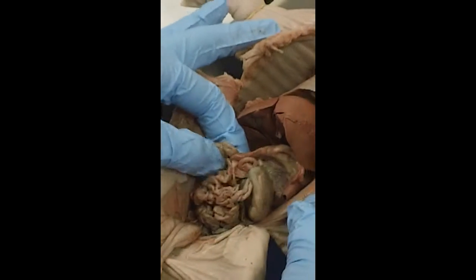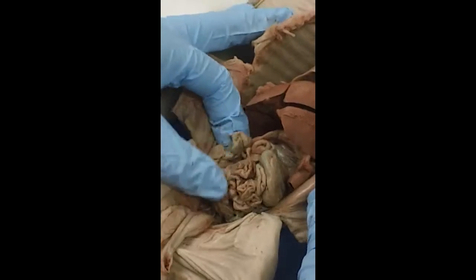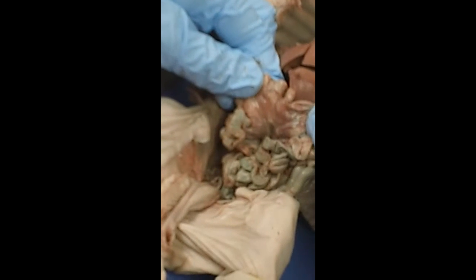The small intestine has 3 main sections. The first is the duodenum, the second one is the jejunum, and the third one is the ileum. And you can see that the small intestine is actually quite long. If you were to take this out and uncoil it, which the lab says you can do towards the end of the lab, it's 6 feet long in this pig. It's held together by this webbing that's called mesentery.